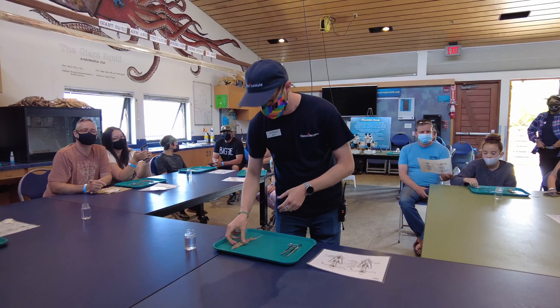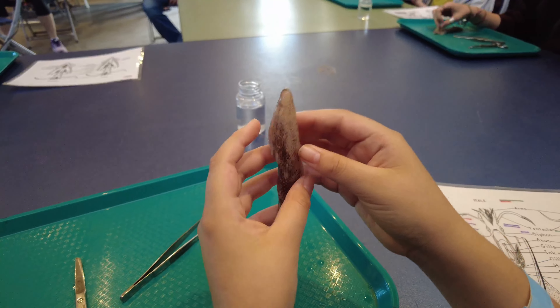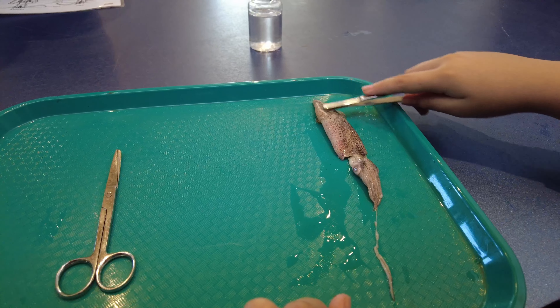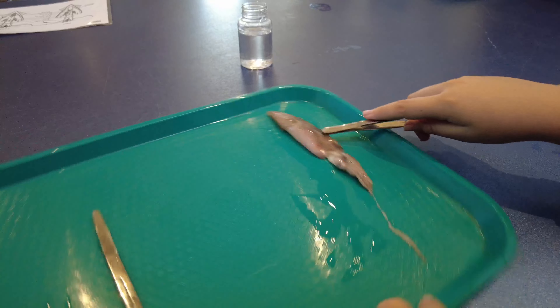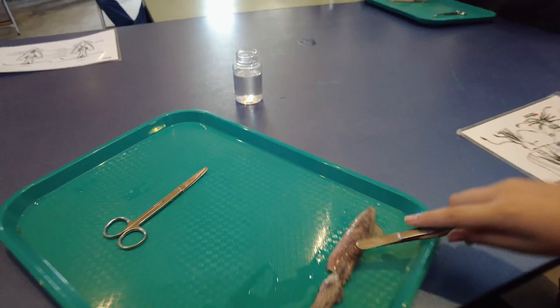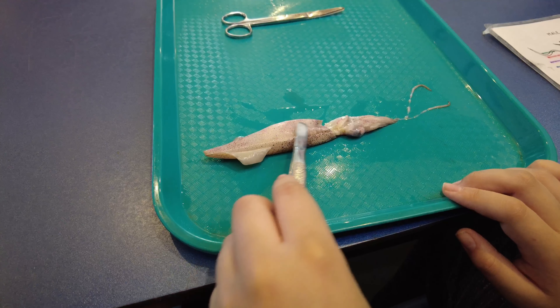Okay, so what we're going to do is we're going to take our squid and orient it. This way? Sure. So what these spins do is they're... Oh, that's cool. It's turning red. Can I roll it? It's actually really turning red.